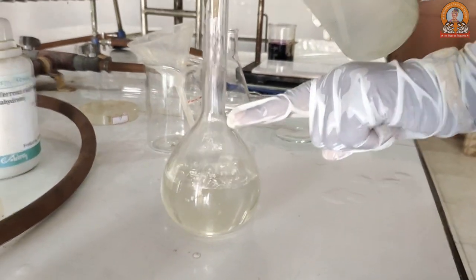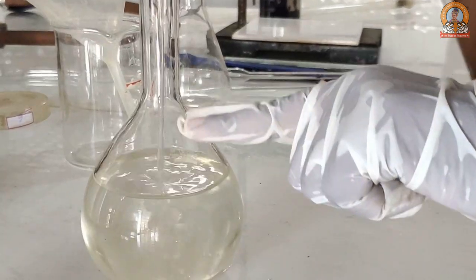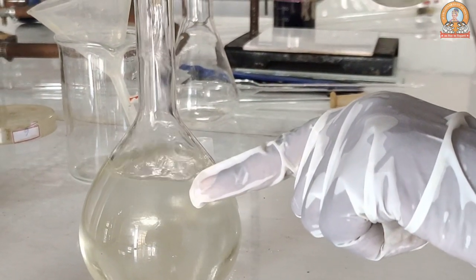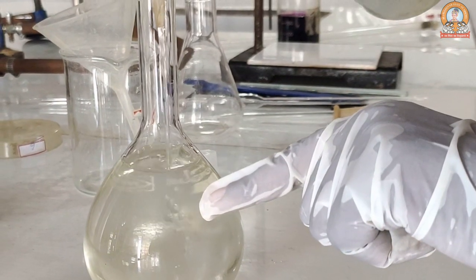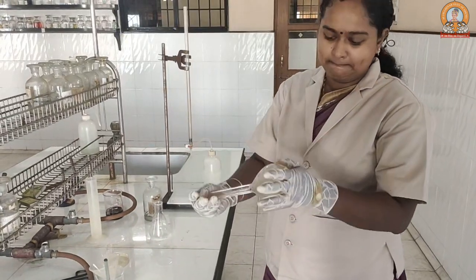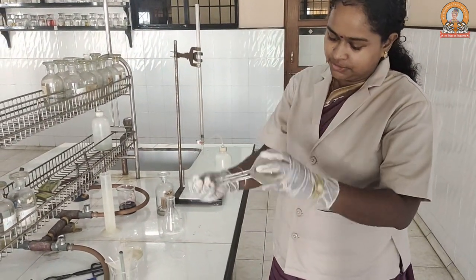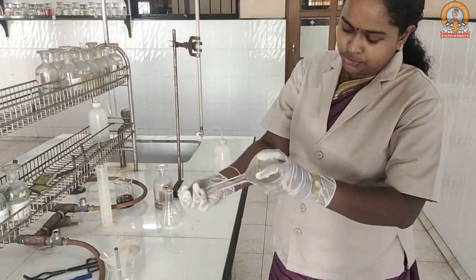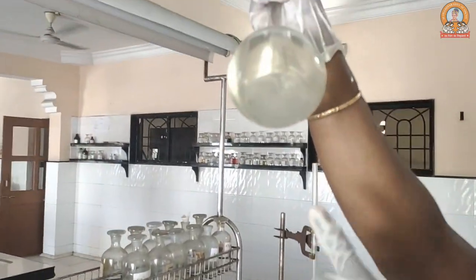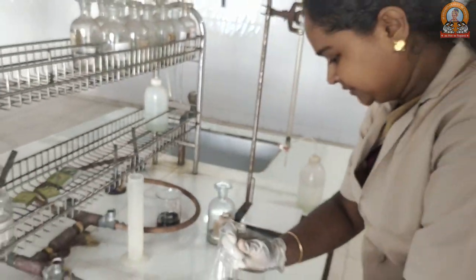You have to fill the water till the bulb of the volumetric flask is fully filled. Then stop there and stir it nicely. While mixing, make sure the cap is not loosened. You can see it is thoroughly mixed, and at the bottom there is no salt precipitate — that is what it should be.